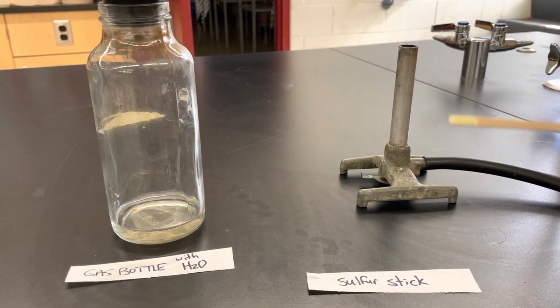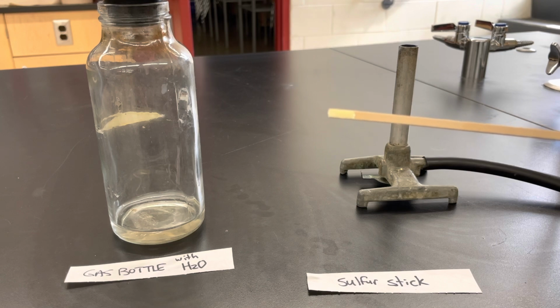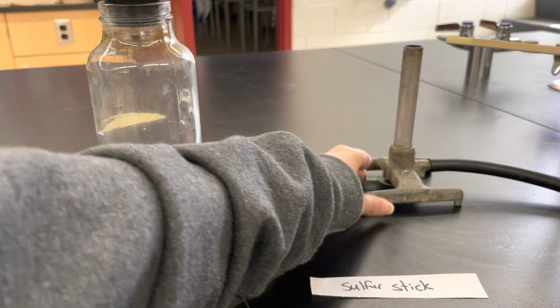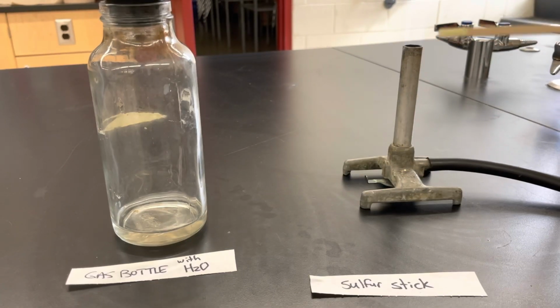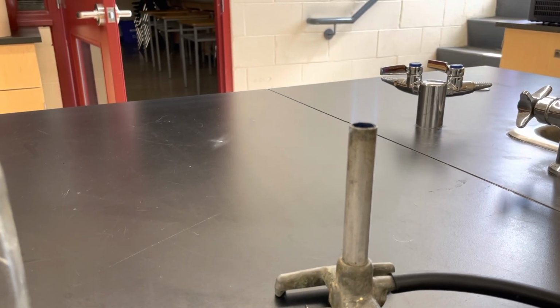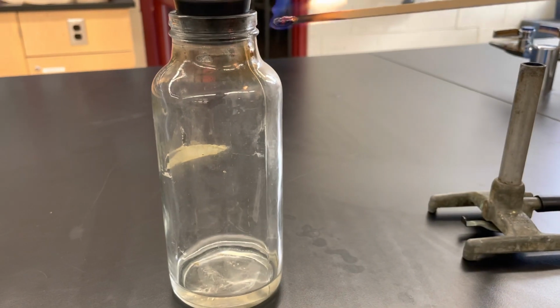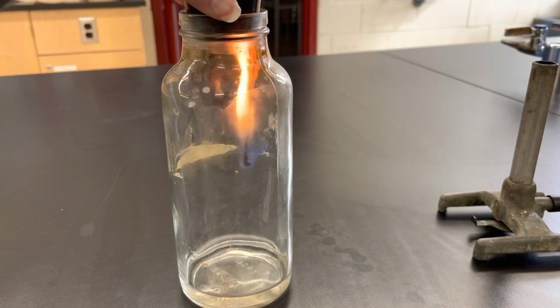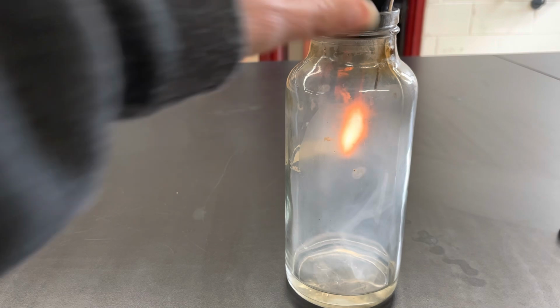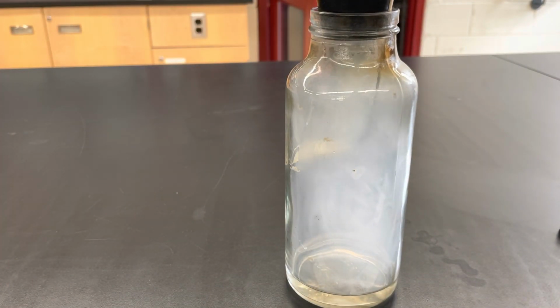Okay, so you want to make some descriptions of your sulfur before we start, and we also want a good description of the sulfur as it's burning. I'll move in closer here so we can see. Okay, so we got quite a bit of gas there, and you should be thinking about what gas that would be if we burned sulfur in oxygen, right? It's one of those synthesis reactions.